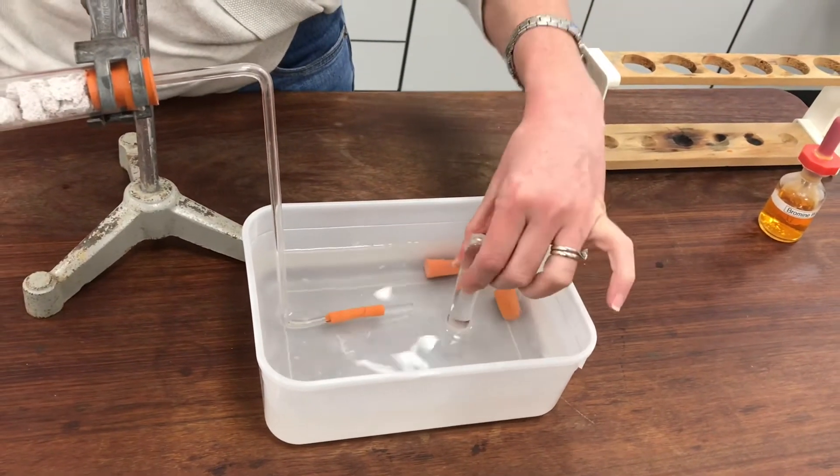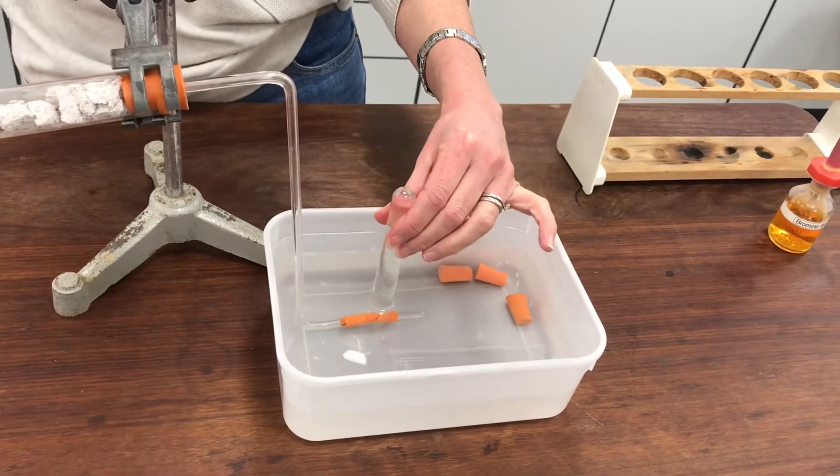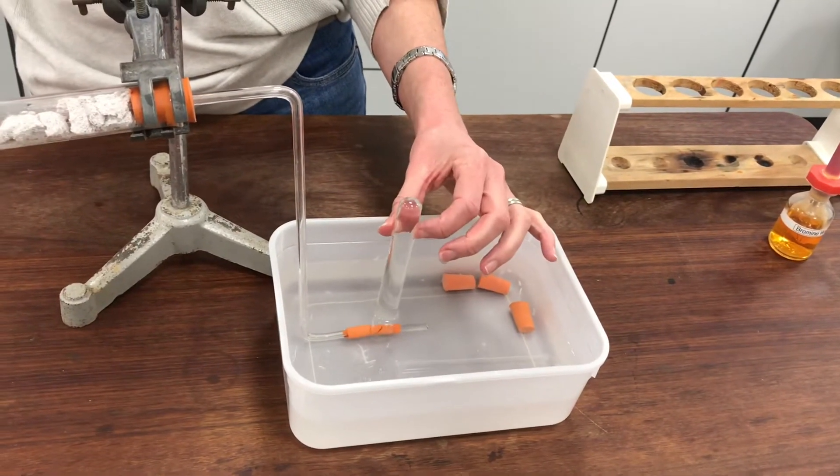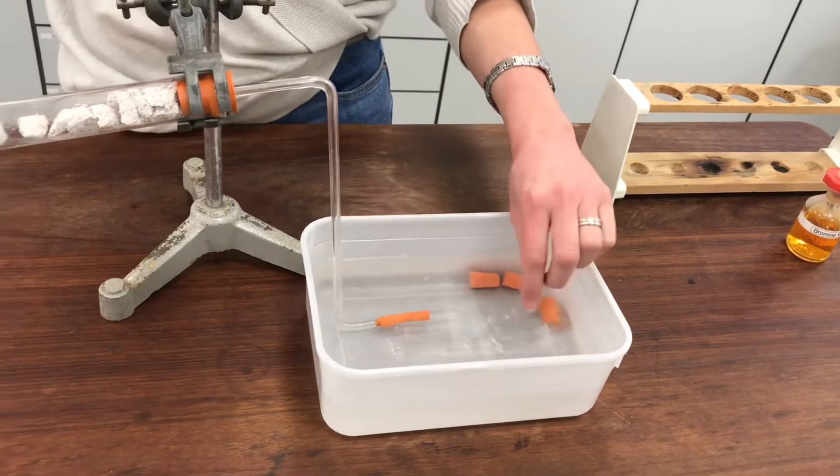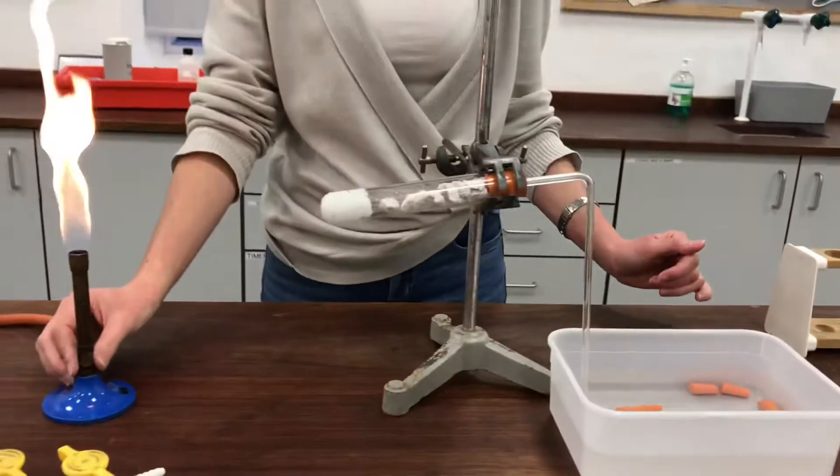I've got some test tubes ready full of water that I'll be able to put over the end of my tube there in order to collect any gas that comes out of there. So I'm going to try heating this now and we'll see how it goes.